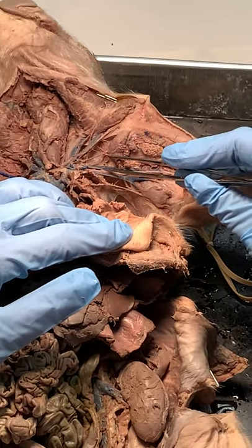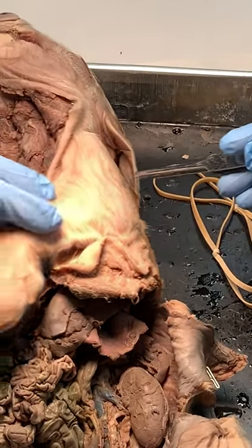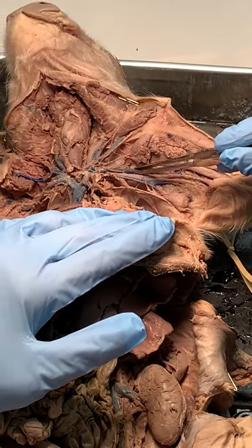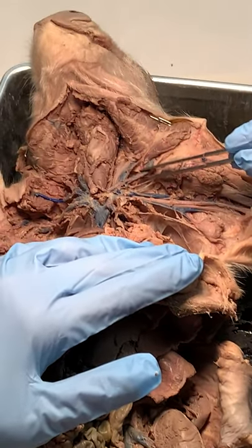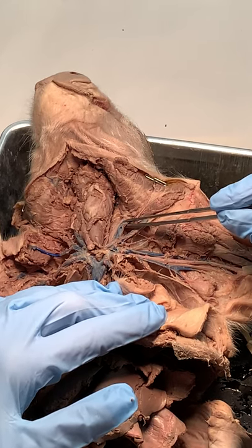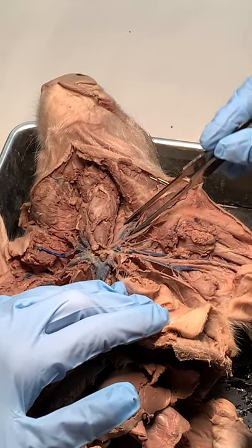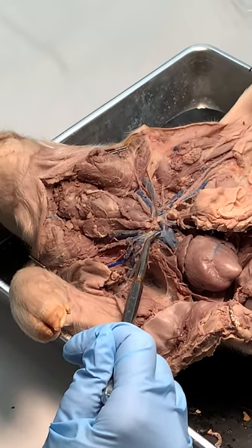The next one is the subscapular. The pig's scapula is right here, so this is the drain from underneath that bone — the subscapular vein. Then going up: axillary, subscapular, then the external jugular on the most lateral part, and the internal jugular closest to the midline. The internal jugular always runs with the common carotid artery — these two run as a pair.